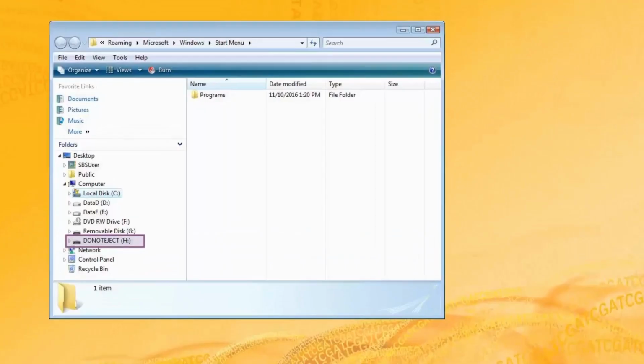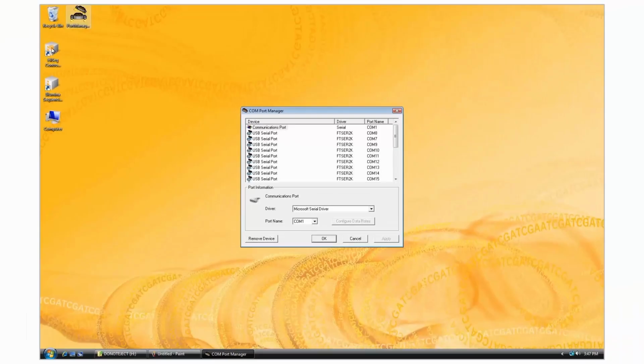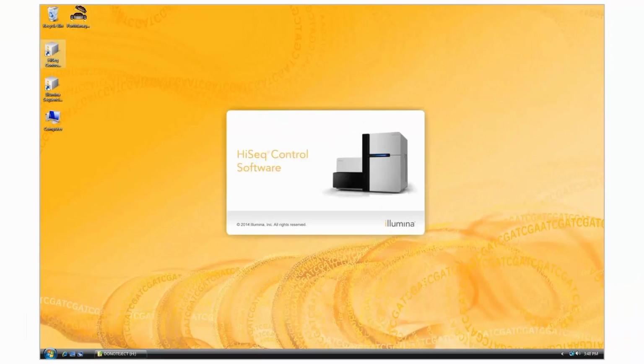Turn on the HiSeq. Wait 2 more minutes to allow all ports to enumerate properly. Confirm the Do Not Eject drive is populated in Windows Explorer. Launch Port Manager and confirm that all 23 COM ports are re-established. Launch HCS to initialize the HiSeq.